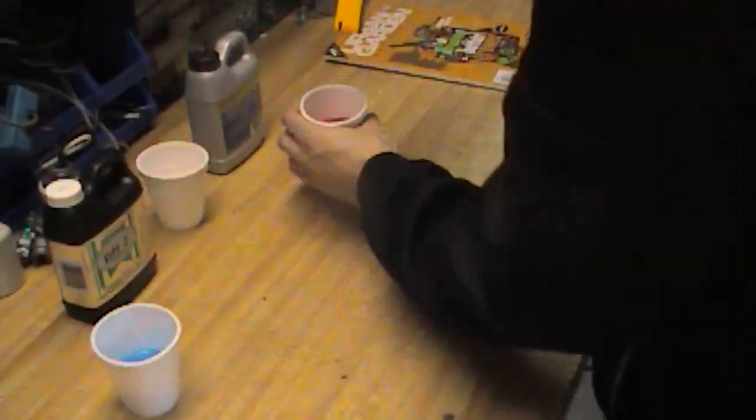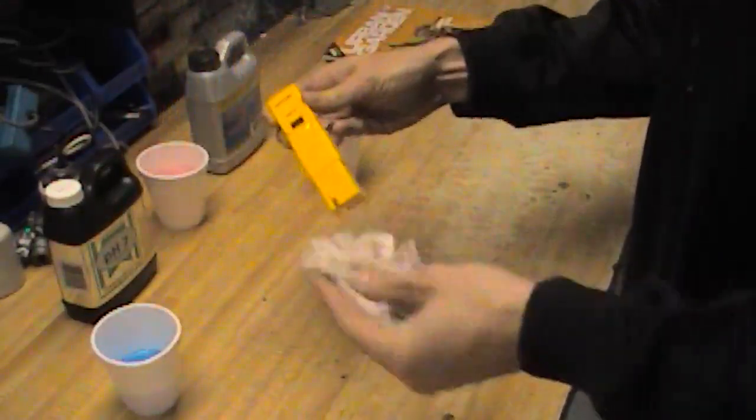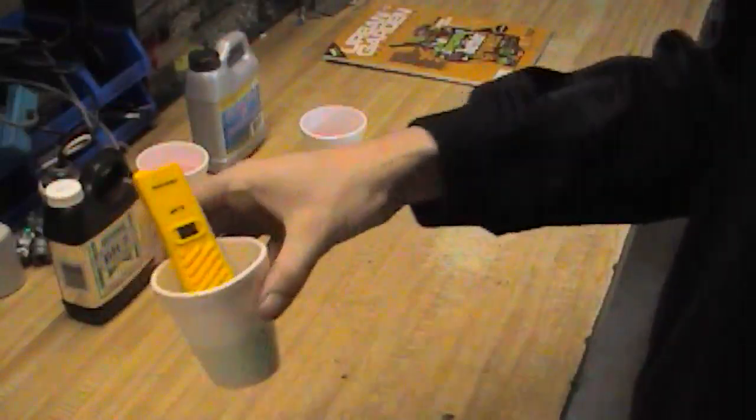So that's good to go. Give it a bit of a rinse, get the buffer solution off it, give it a bit of a wipe. Now let's put it back into 7 and see how well we did here.